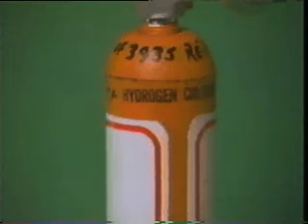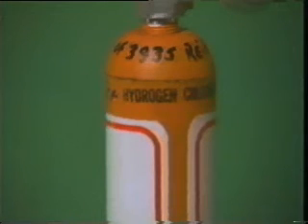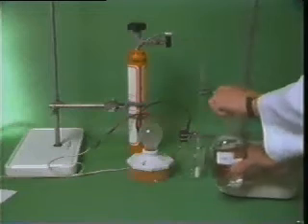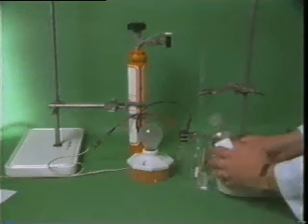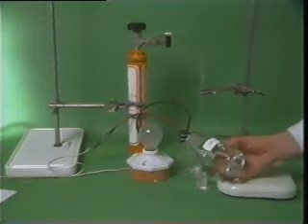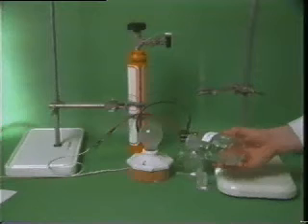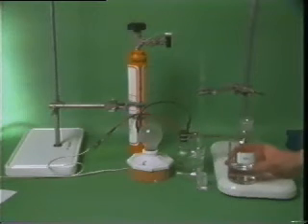Hydrogen chloride is a colorless gas which is soluble in water and benzene. Pure water is poured into a beaker. Water has a very low conductivity and the bulb remains unlit.